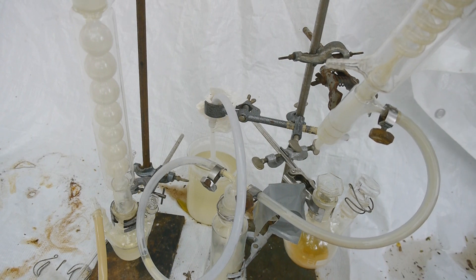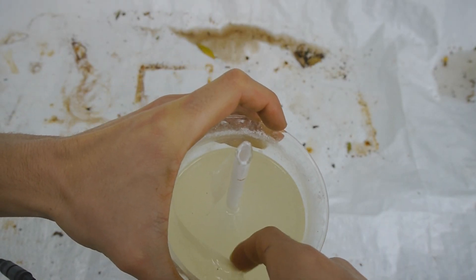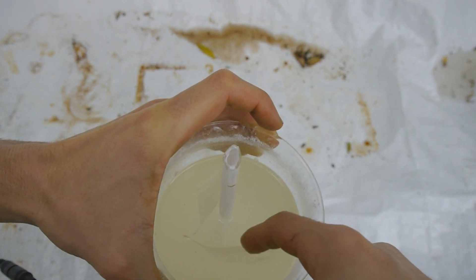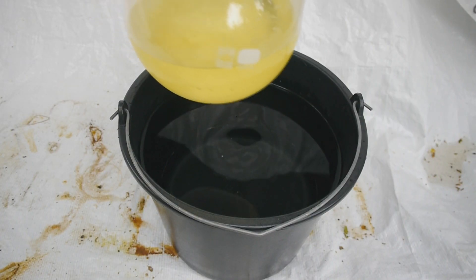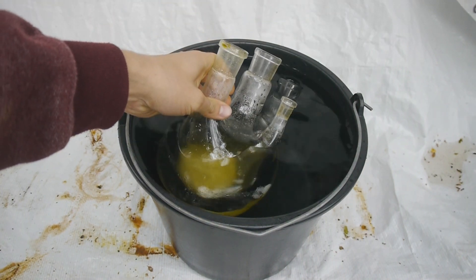And as you can see, this is fuming quite profusely. That's funny — some leaves fell into the absorption medium where I was catching the chlorine with sodium hydroxide. And as you can see, they've lost all their color, so this is some quite concentrated bleach now, I guess. So to neutralize the chlorine generator, I will just let it sink in some water.